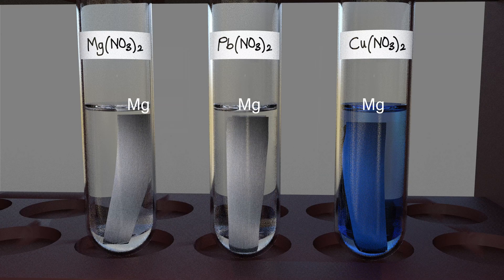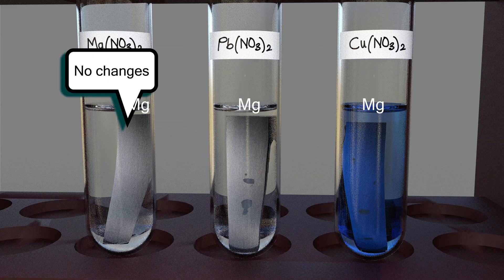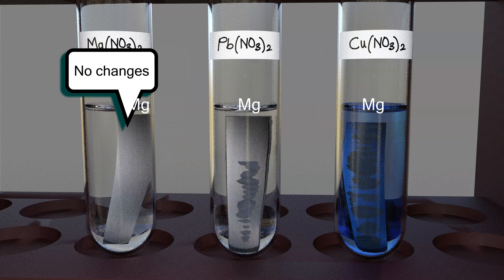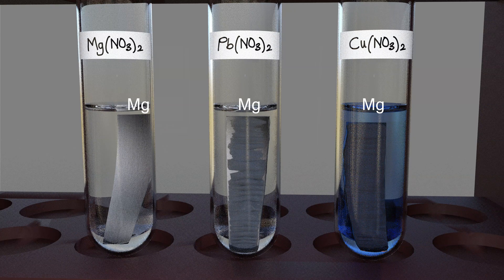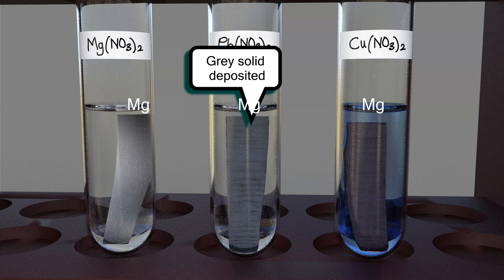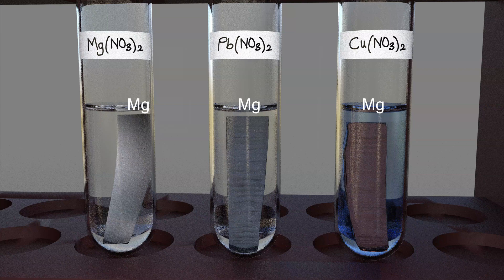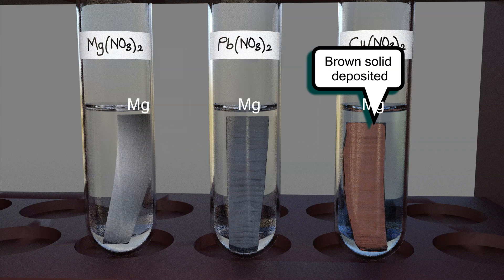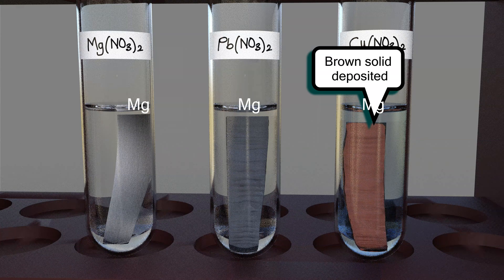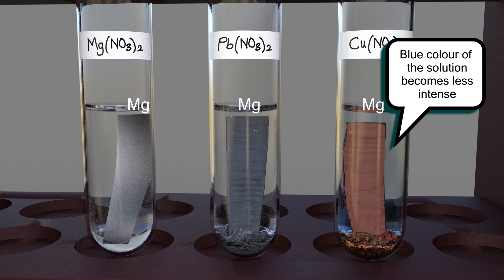In the test tube containing magnesium nitrate solution, no changes can be seen. In the test tube containing lead two nitrate solution, a gray deposit can be observed — this deposit is lead. In the test tube containing copper two nitrate solution, a brown solid deposit is observed — this deposit is copper metal. At the end of the reaction, the blue color of the copper two nitrate solution becomes less intense.